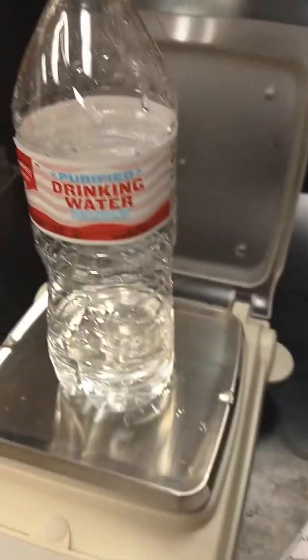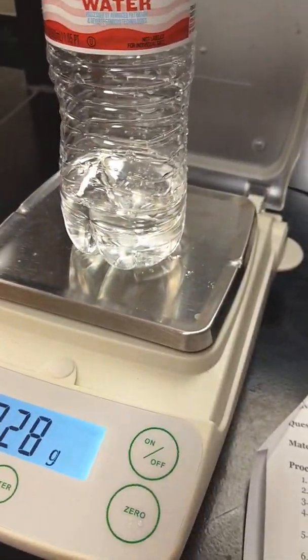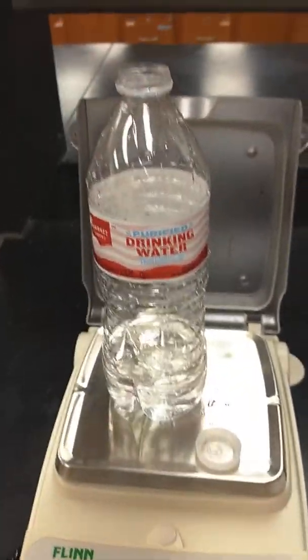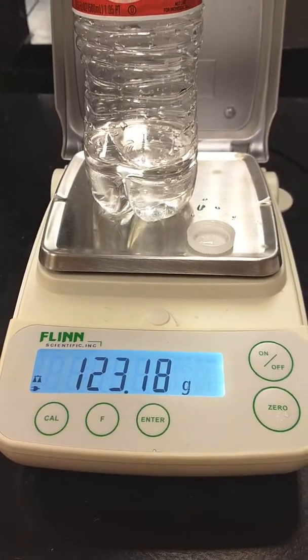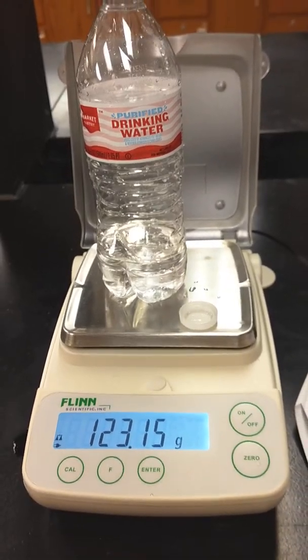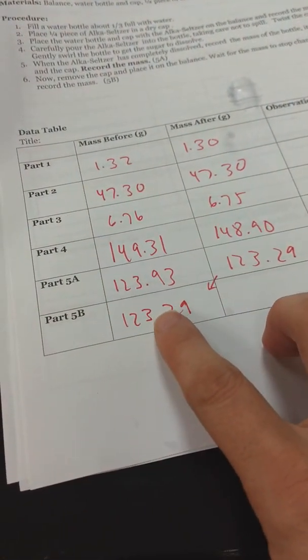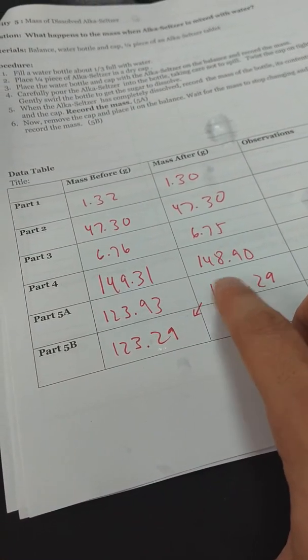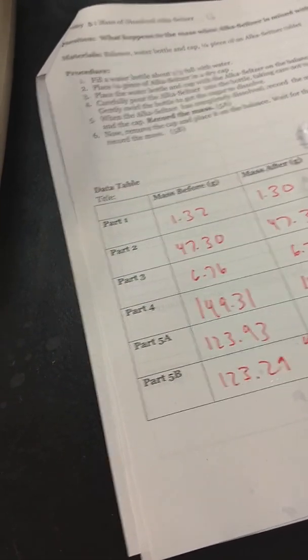The last part is to take the cap off, leave it on the scale, and wait until the mass is done changing, if it changes. I've pulled the cap off and now you can see the mass has changed. The mass is holding steady at this amount, so be sure to record it. Make sure you realize this starting value is where you left off — this is with the cap on, and then with the cap off.